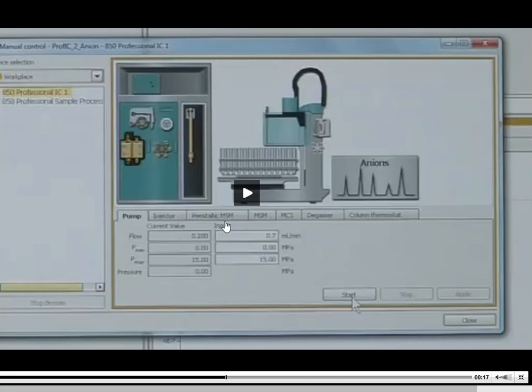So if I turn the pump on and I have the purge valve open, then whatever number is there is going to plummet and go way below 0 for me. And when that goes below a 1 and closer to 0, then that machine is going to turn itself off, and I will not be able to purge my pump because of it. So always remember, change that number to 0 when you go into purge. That is not a default setting. I wish it was, but it's not.